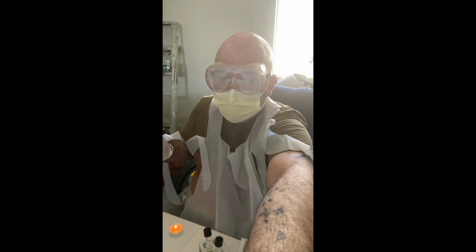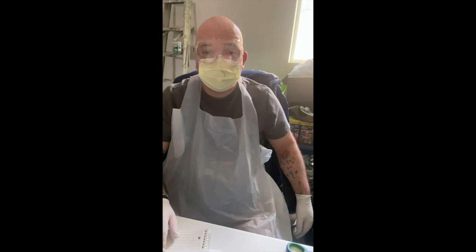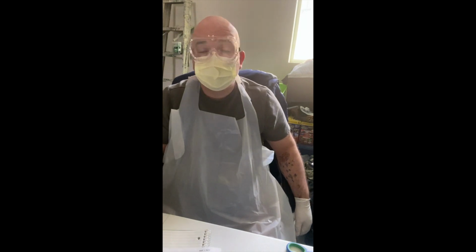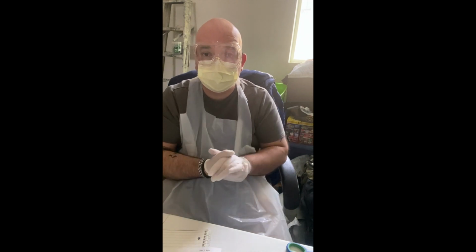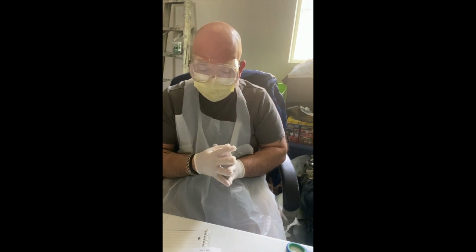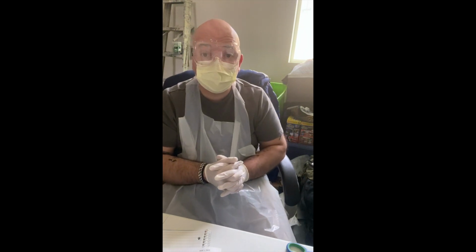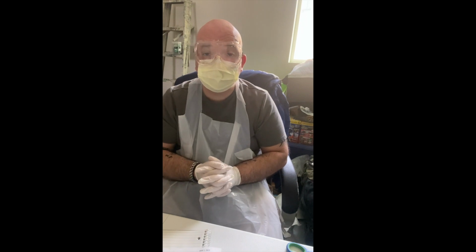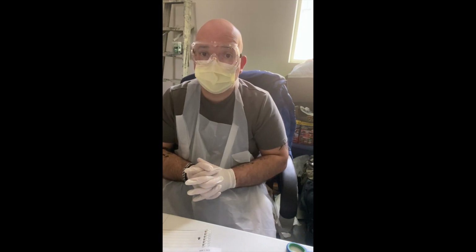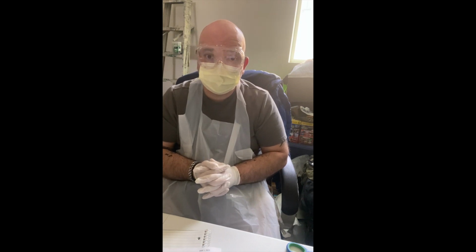All right. Good morning. Today is Sunday, June 7th, 2020. My name is Ricardo Sandoval, and this is a continuation or the final portion of lab number 7, bacteria identification through functional media motility testing. This lab is for week 4 of Biology 225, microbiology at Los Angeles Pacific University.